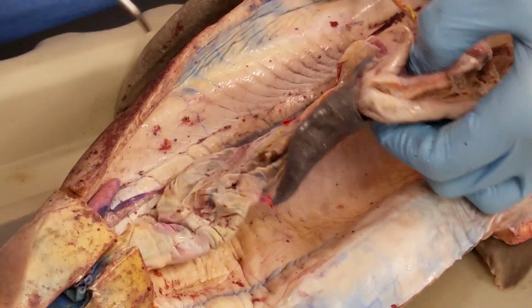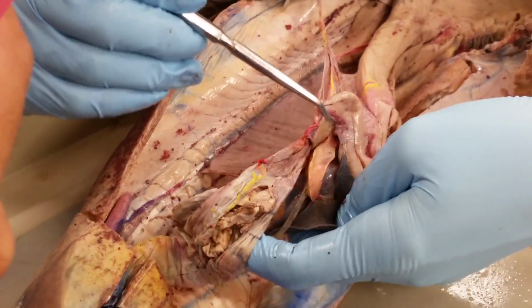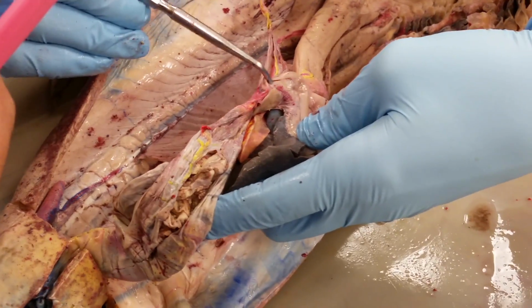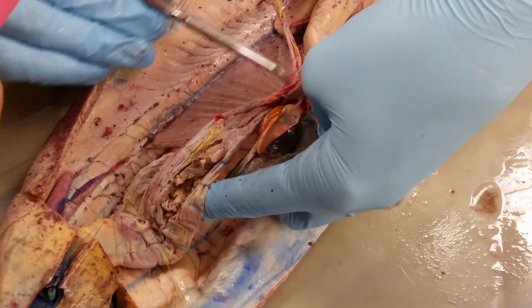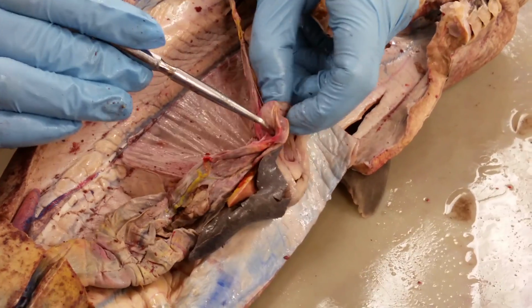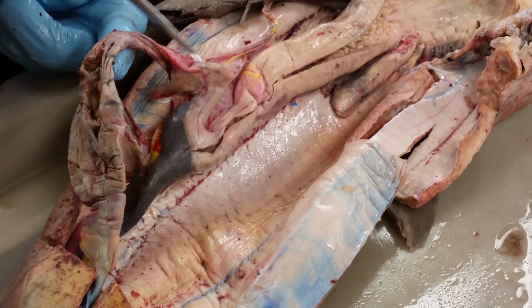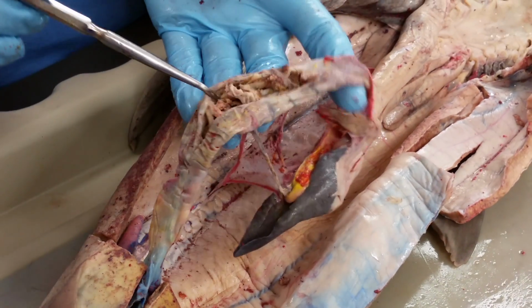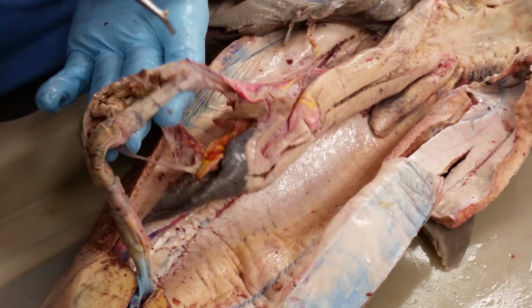Okay, now the duodenum is really small in the sharks, as opposed to what you see in the cats. So they've got the position of our pyloric sphincter here, which is hardened, and where the stomach comes to an end there. Okay, then this short little section here, so everyone can see, this short section here is the duodenum. Then this whole thing here is the valvular intestine with the spiral valve. You can see the different levels of the spiral valve inside. Okay?